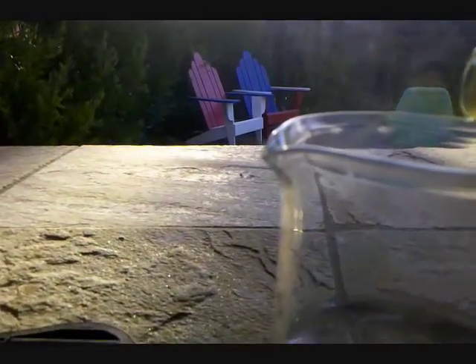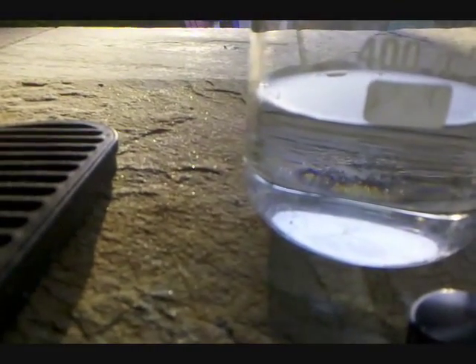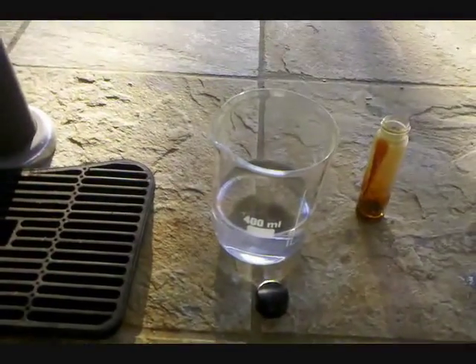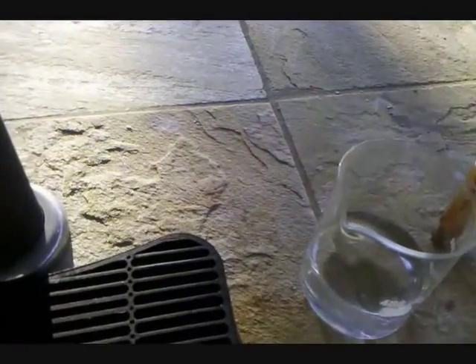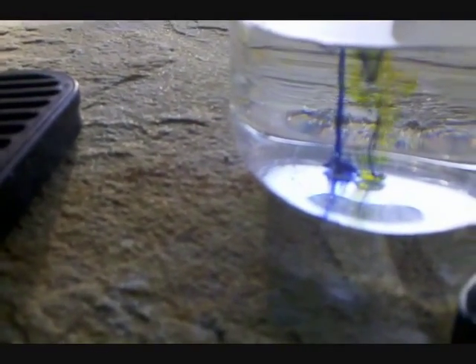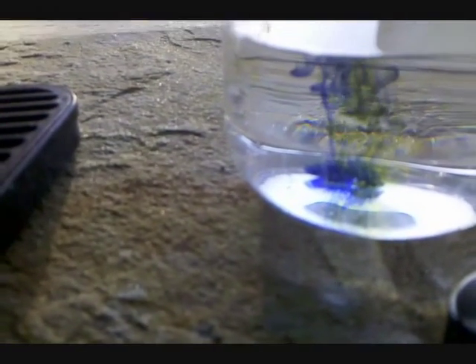If I just tilt the vial over the top of the beaker, some chromyl chloride fumes — which, as you can see, much resemble bromine's — will come into the beaker, and you should start to see a blue layer form on the top. It looks like it's a little windy out here, so I don't think any of the fumes are making it down to the liquid. So I'll use a pipette, take up a drop of chromyl chloride, and add it to the beaker. The chromyl chloride can be seen bubbling at the bottom of the beaker and turning blue.